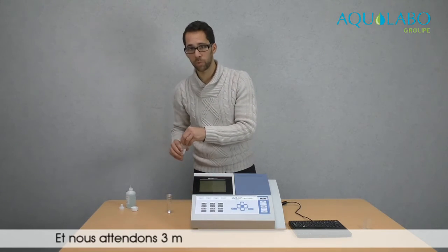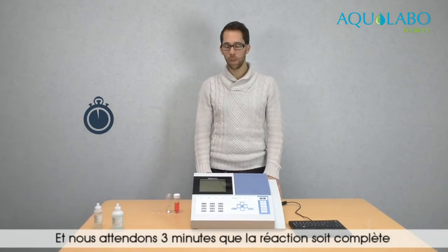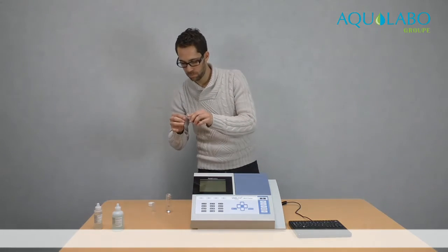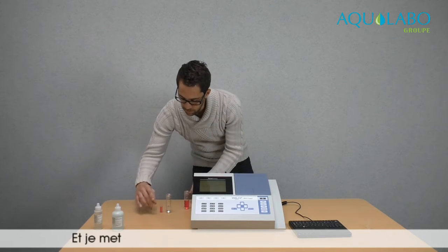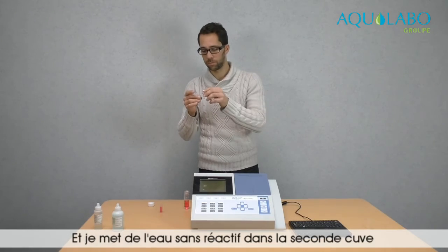And then we wait 3 minutes for the reaction. Now my sample is ready. I will put it in a cell. And in the second cell, I will put the water sample without reagent.